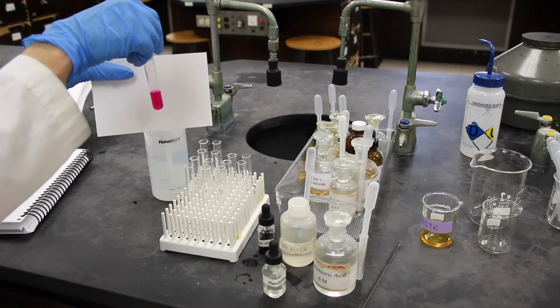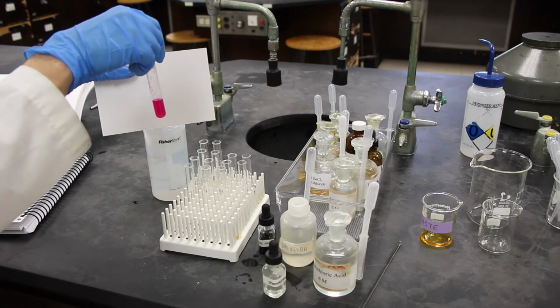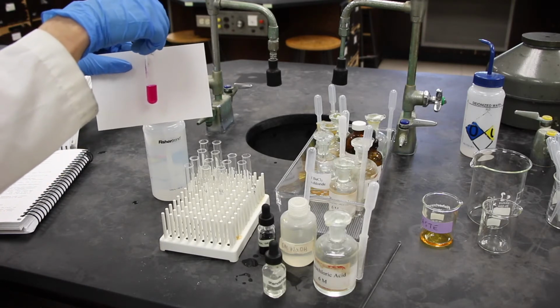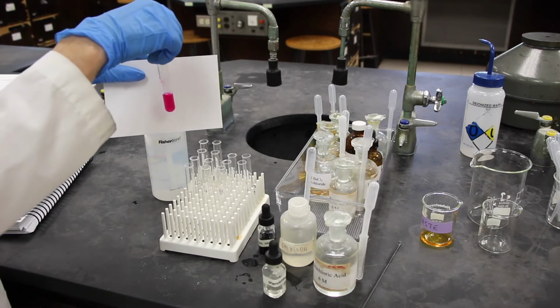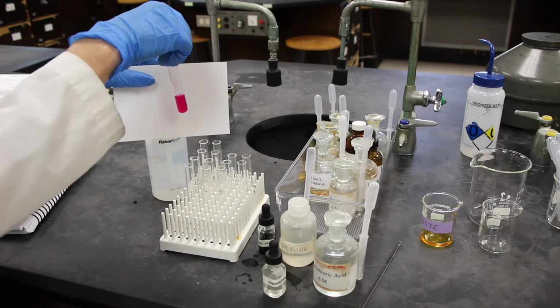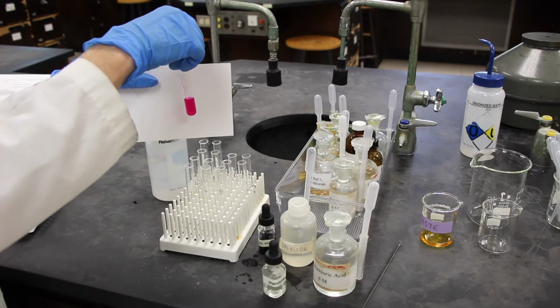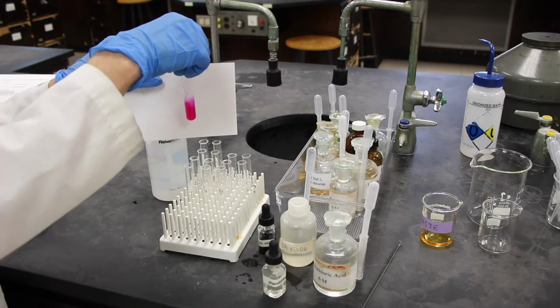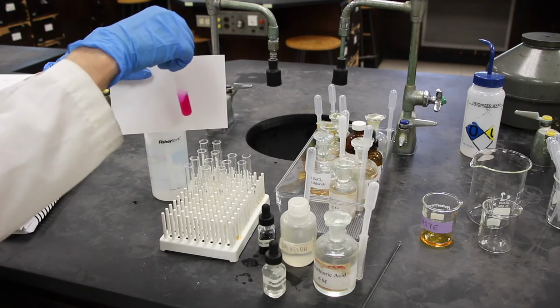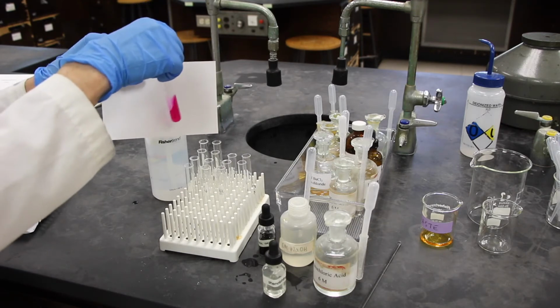You can also answer the next question. B13, what is the stress on this system? We added sodium hydroxide, the Na plus and the OH minus ion. Do you see either one of those ions in the balanced net ionic reaction? And you can tell the stress, the direction of shift, and give me an observation and interpretation.